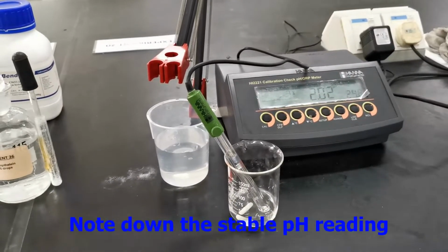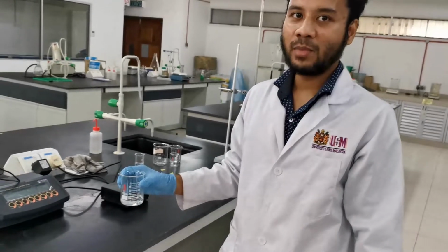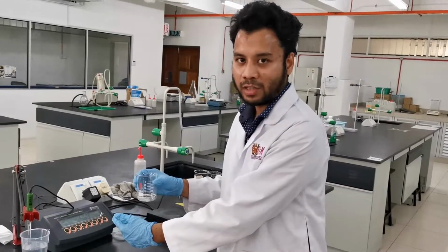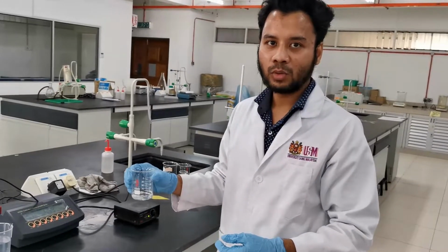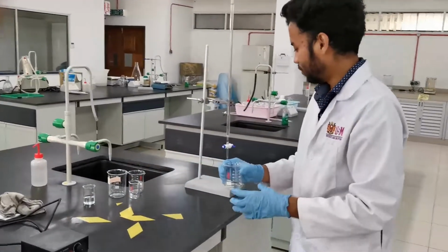Once you get a stable reading, just note down the pH value. We already added 1 ml of the sodium hydroxide solution into the unknown and measured the pH of the final solution. Then you need to add 1 ml more and repeat the same steps as before.